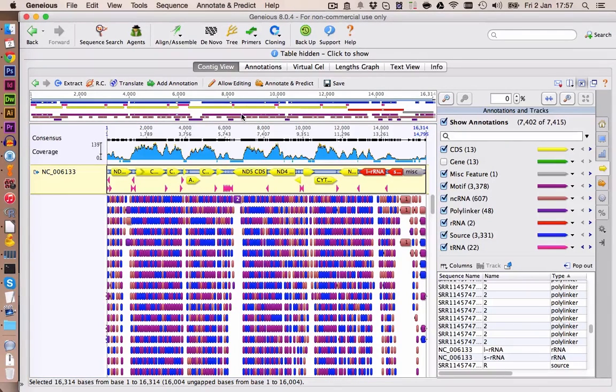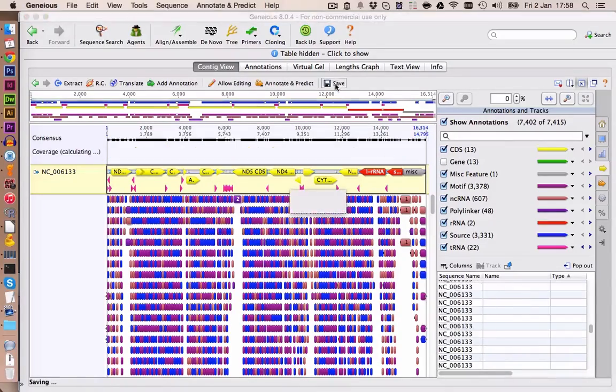The line in purple and the line in blue are the colors of the left and right BLAST hits. And as you can see, they both have roughly the same pattern. So by adding the right reads to the dataset, we didn't gain any more information. This indicates that it's very difficult for the BLAST algorithm to map those reads on the edges. So we probably have to try something else. So let's save this for now.